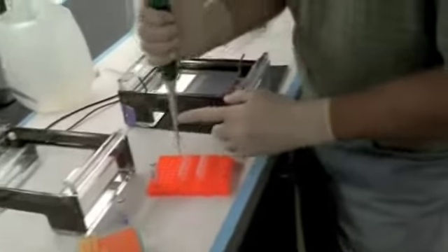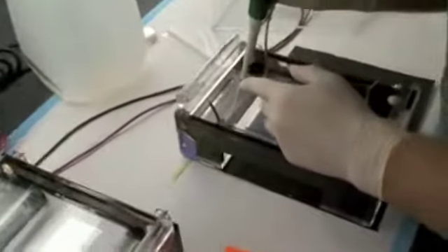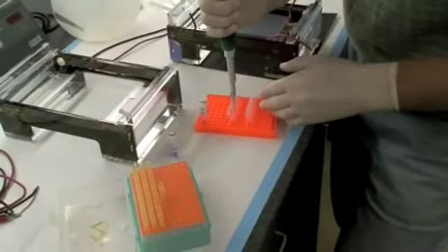I don't go quite down to the bottom. I'm using both hands. I'm getting 15 microliters. I'm sticking it in there.